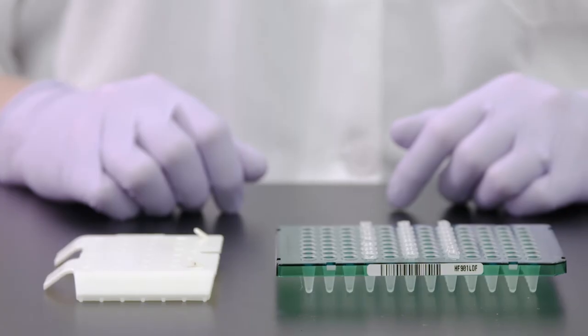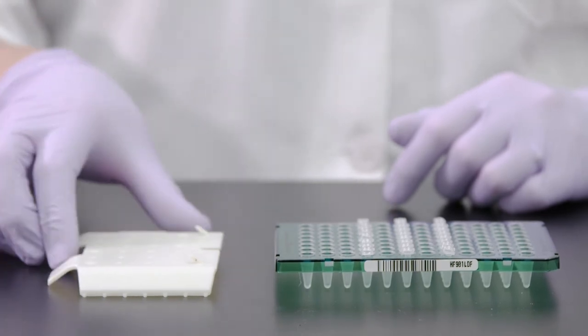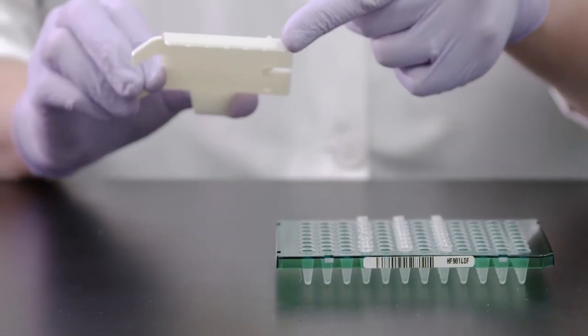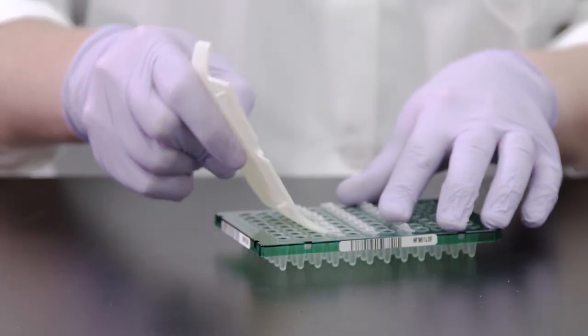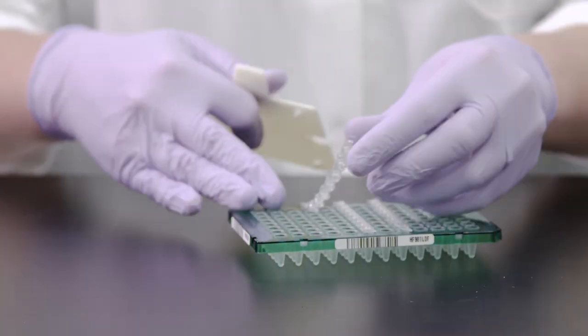The multi-removal tool is used to open strip caps with ease. Just insert the small protrusions on the side of the multi-removal tool under the cap strip and slowly pry to open the caps.